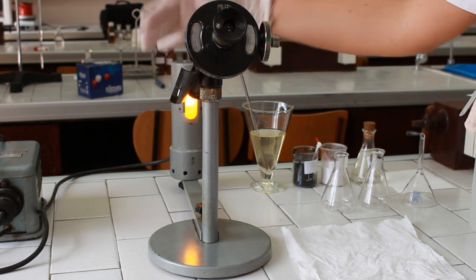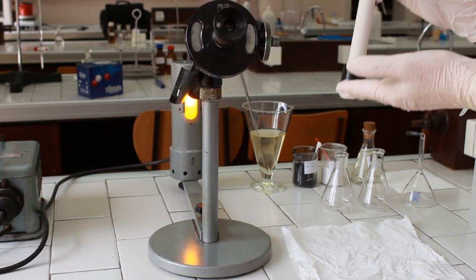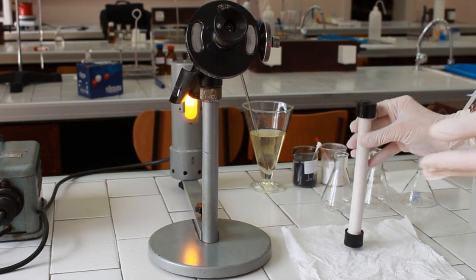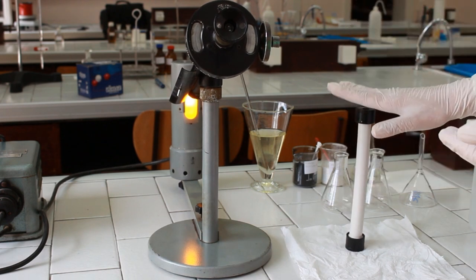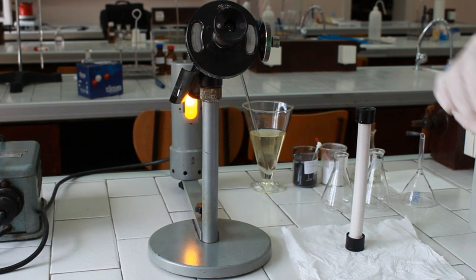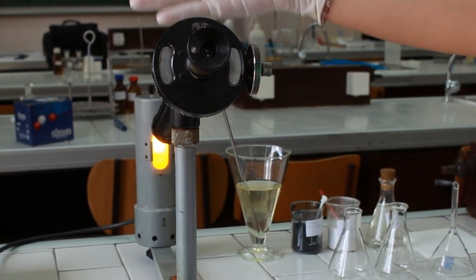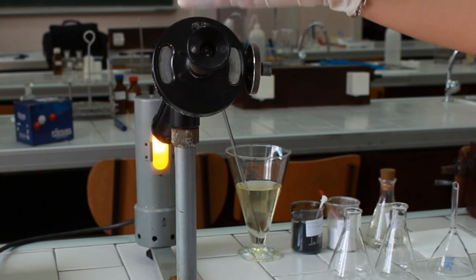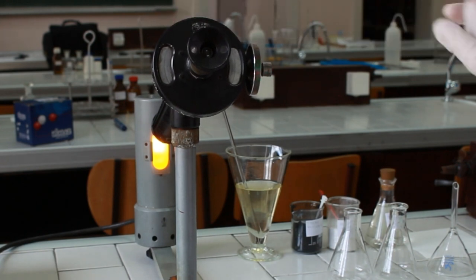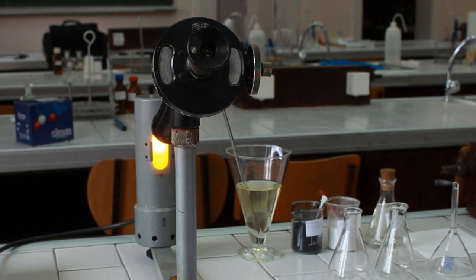Then we have the body of the polarimeter in which we are going to place the polarimetric tube, in which we are going to pour the optically active substance solution. Then we have an analyzer, which is used to calculate and measure the angle of rotation of the plane of polarized light.